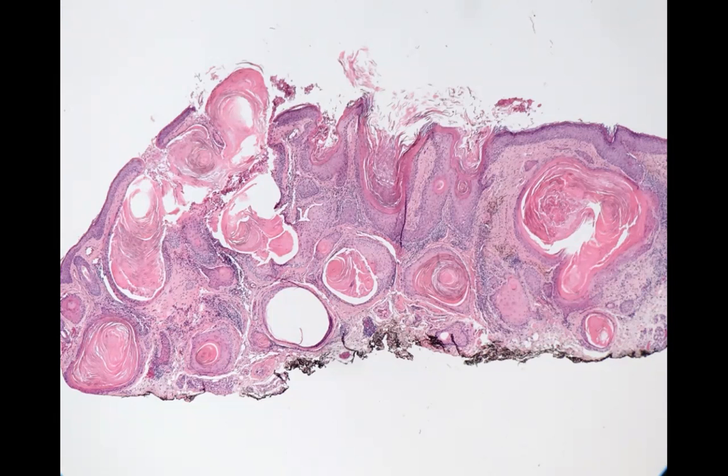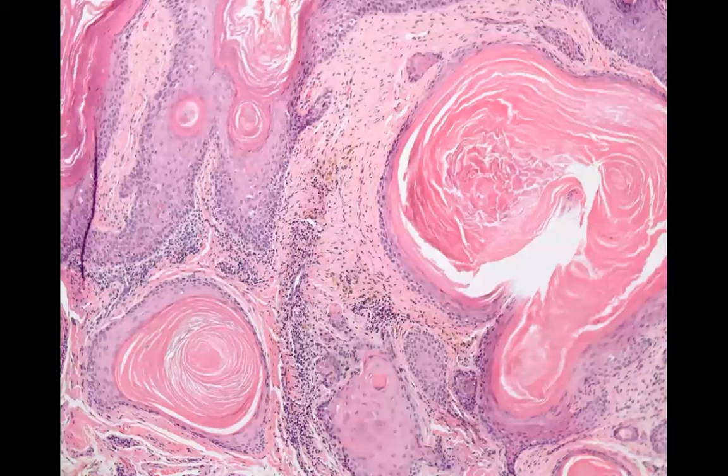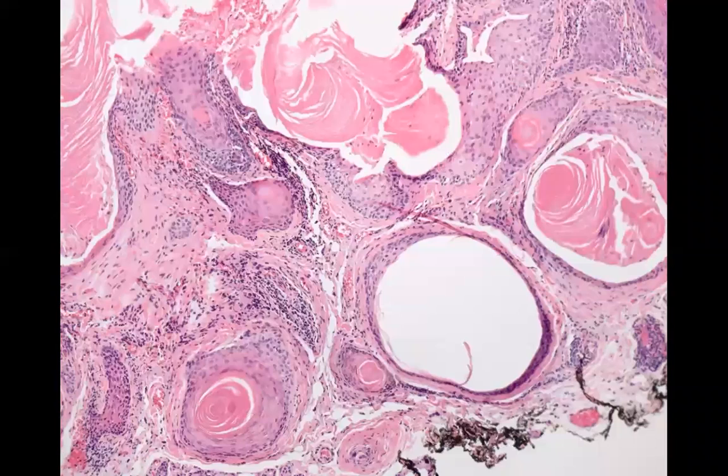This one's kind of hard to see. I don't think it's stained very well. But this is what a trichoadenoma looks like. And then, of course, in this adnexal neoplasm section, what a lot of people find frustrating is that a lot of it's memorization. So I kind of want to give you a general approach, but eventually you're just going to have to memorize a different pattern.